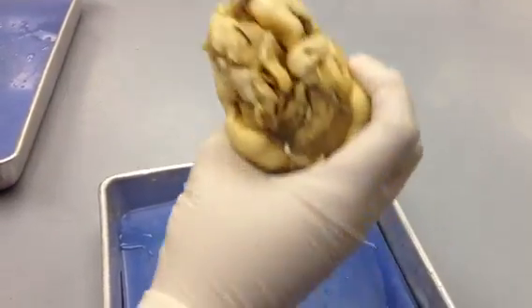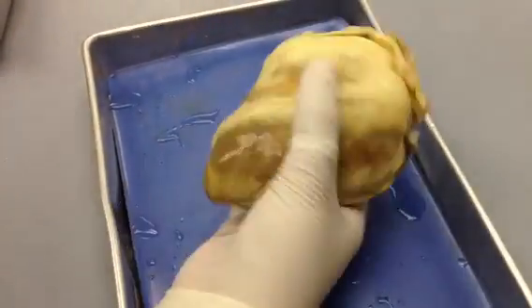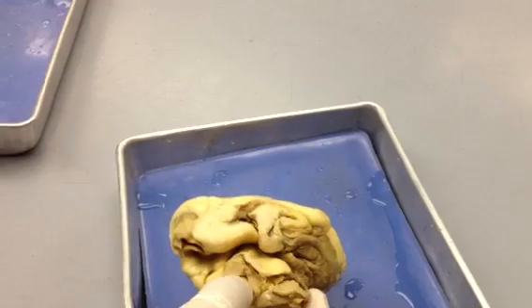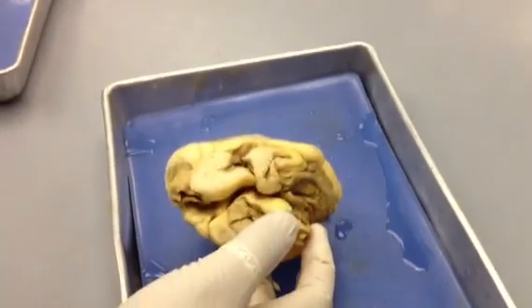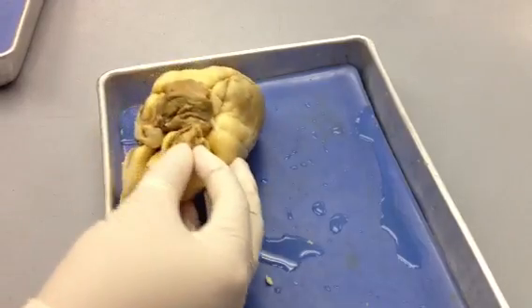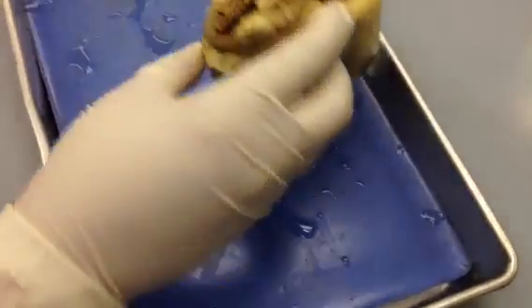And then if you look, just orient yourself on top. So left, right, face towards you. You can usually see that you have your aorta, your pulmonary artery, and then you can see some of your superior and inferior vena cava. Here is the superior. Your inferior is hard to see on here, but that's the heart.